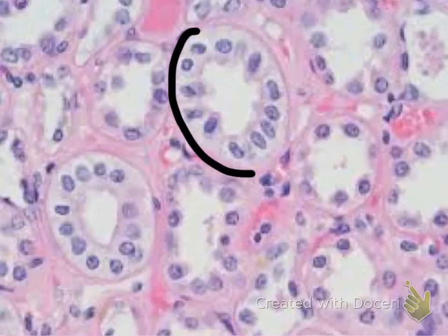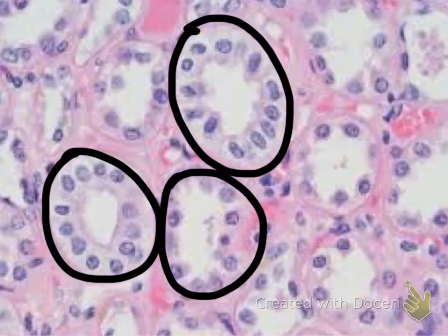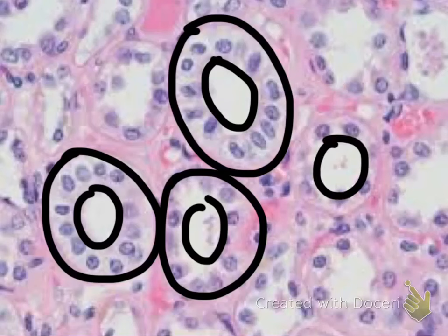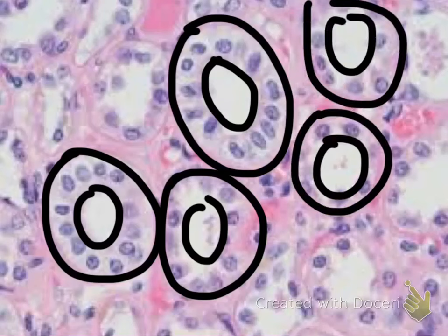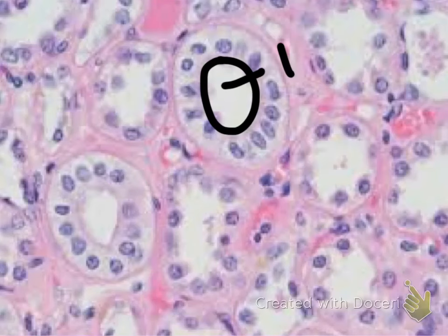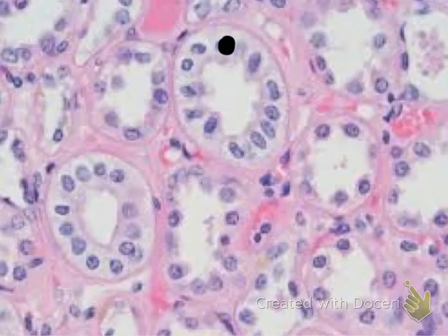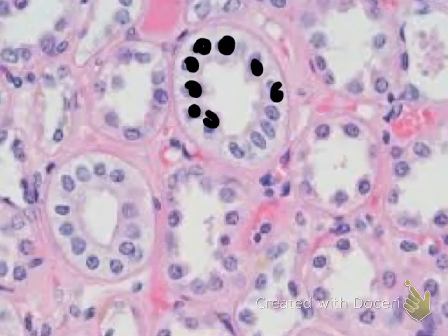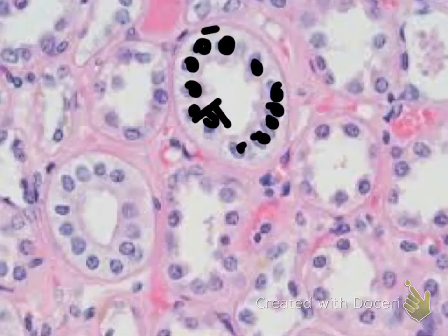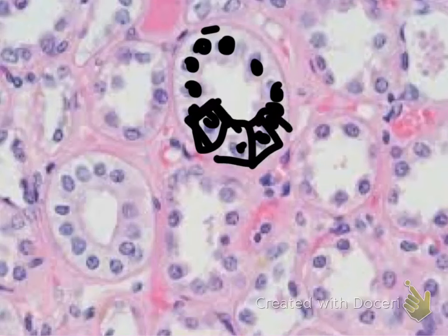Here's your basement membrane on multiple structures, and here are your apical surfaces. All of these are your epithelial tissue. The space inside this area is called a lumen. The shape of the nuclei are oval, and there is only one row of nuclei. One row tells you simple. The shape of the cells are cube-shaped with round nuclei. So this is your simple cuboidal epithelium.